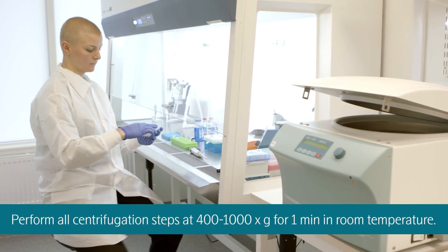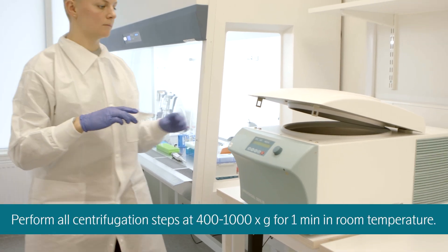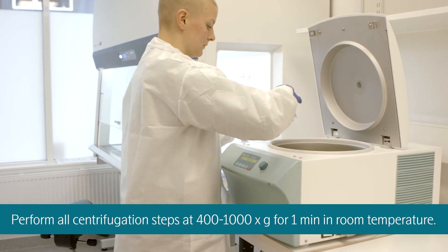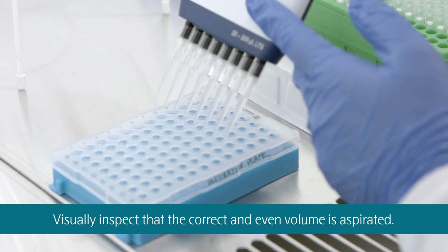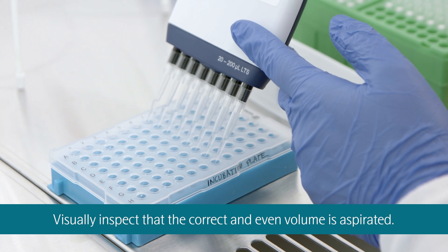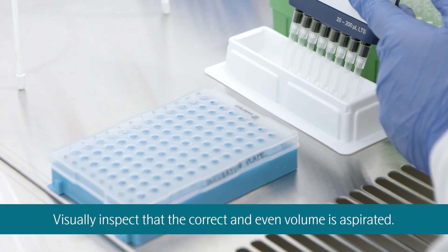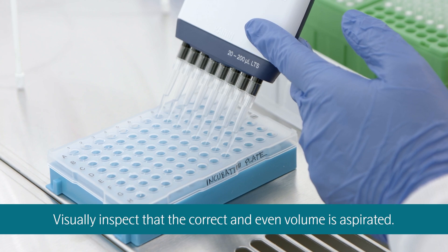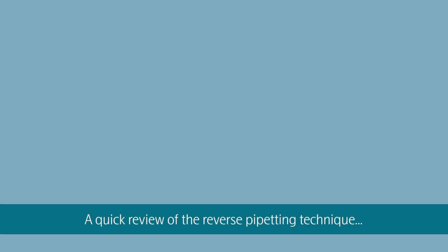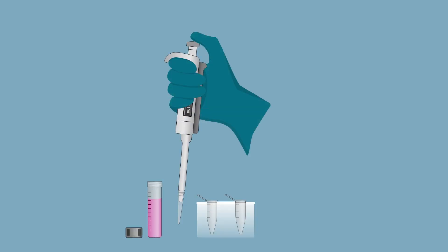Perform all centrifugation steps at the suggested centrifugal speed and time specified. And always visually inspect that a correct and even volume is aspirated during each pipetting step. In some steps of the protocol, reverse pipetting should be used.